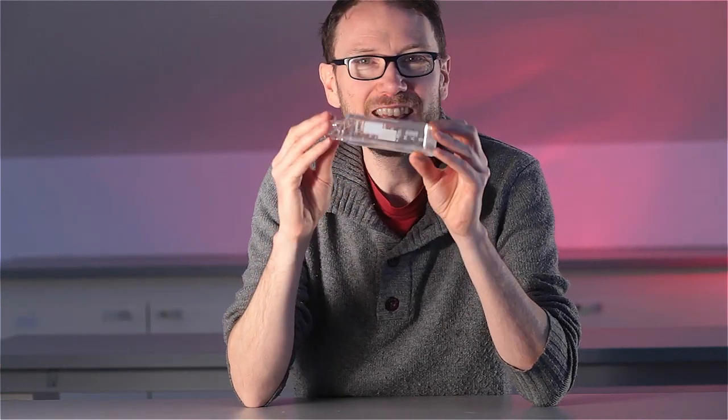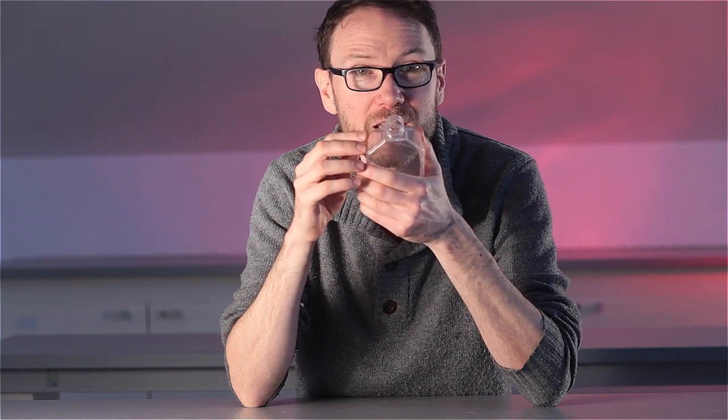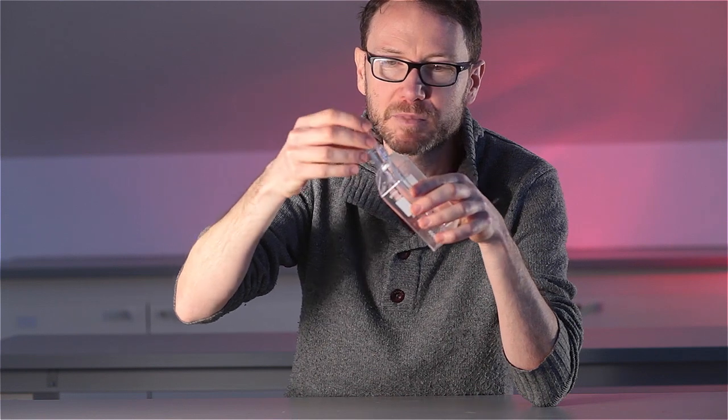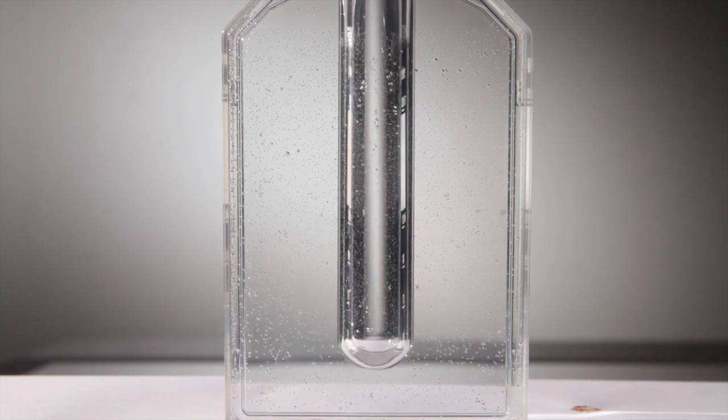You guessed it, it's the cell culture flasks from biology again. Now, these ones happen to have an internal neck diameter pretty much equal to the outside diameter of a 15mm test tube. So you may not even need a clamp. And even if you do, the angle on the neck here will hold it in place pretty nicely into your solution.